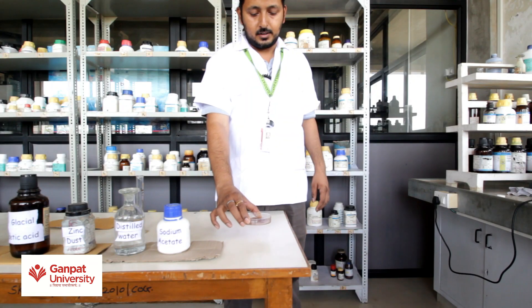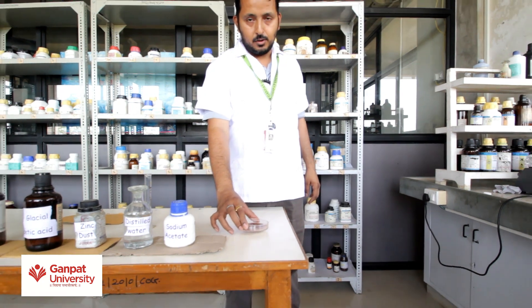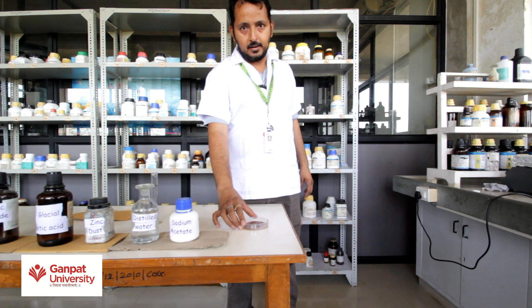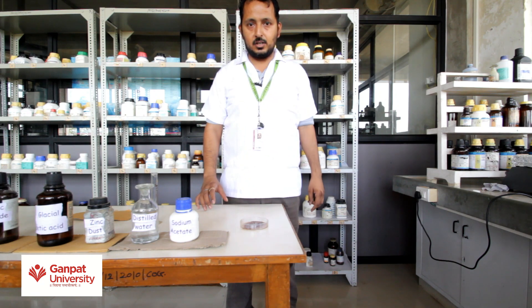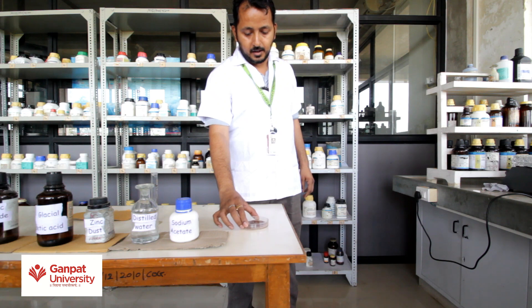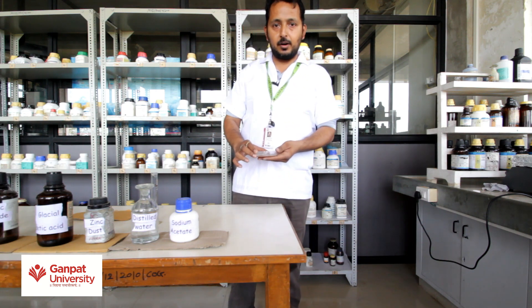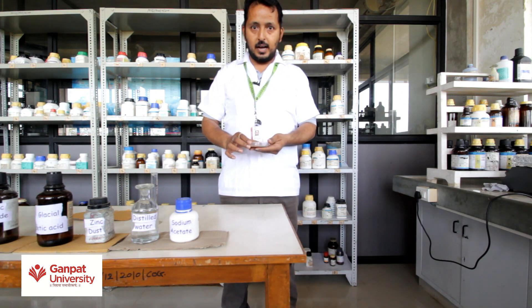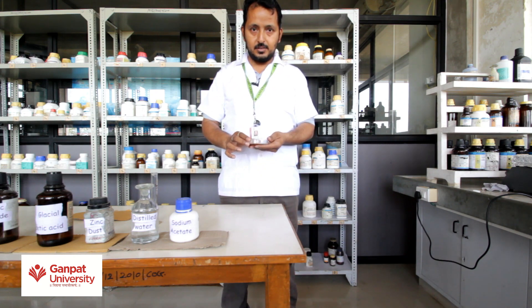Now this crude product is a sample of acetanilide. To get pure crystals of acetanilide, we should carry out the crystallization method. In crystallization, add this crude product into hot water and heat for 10-15 minutes.